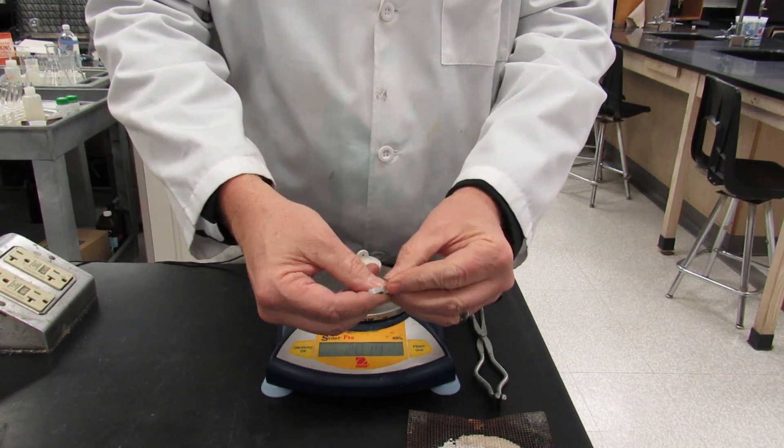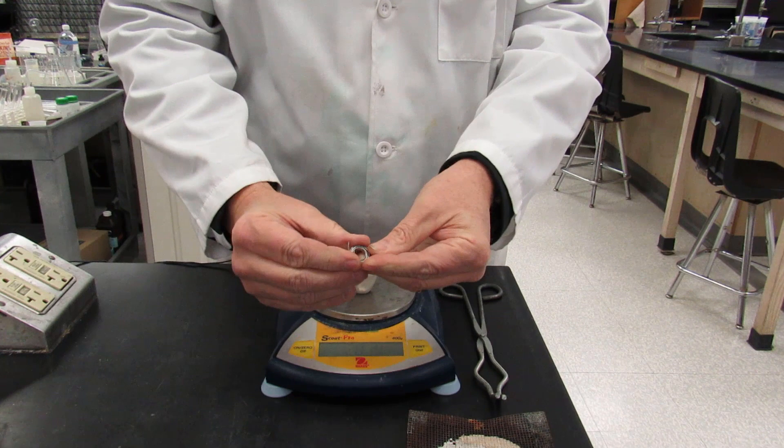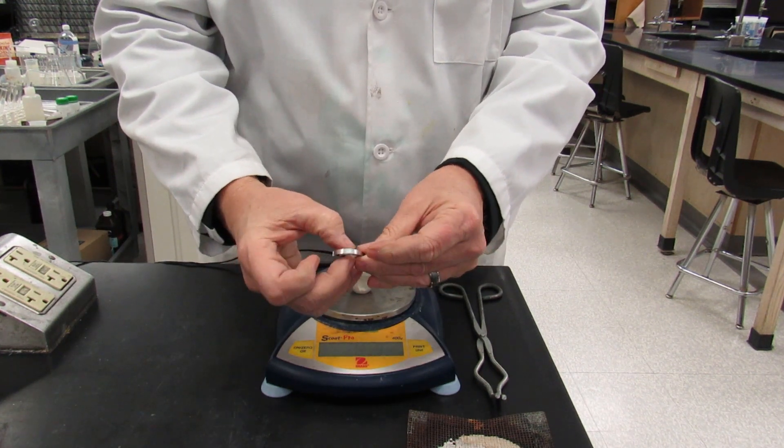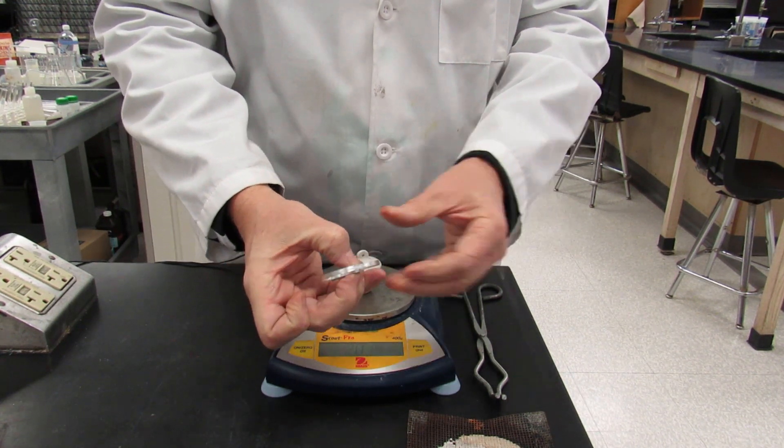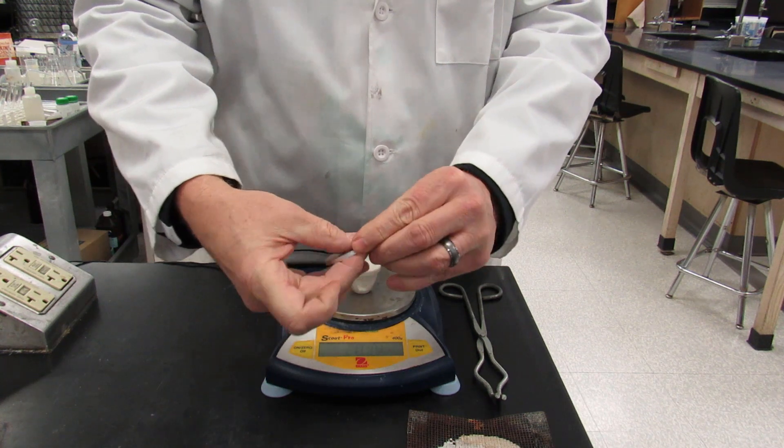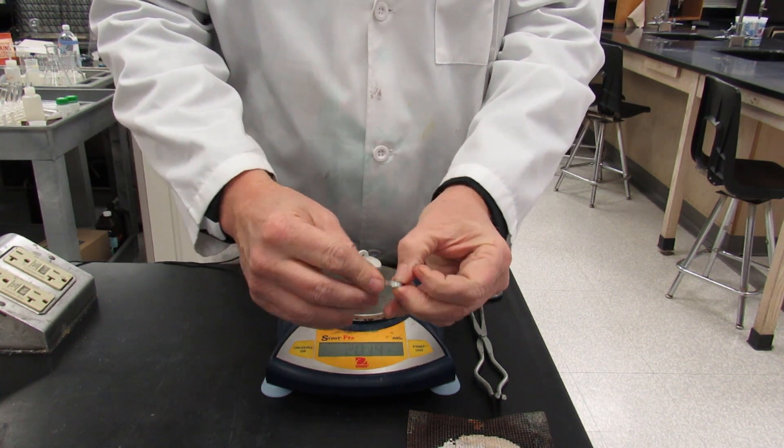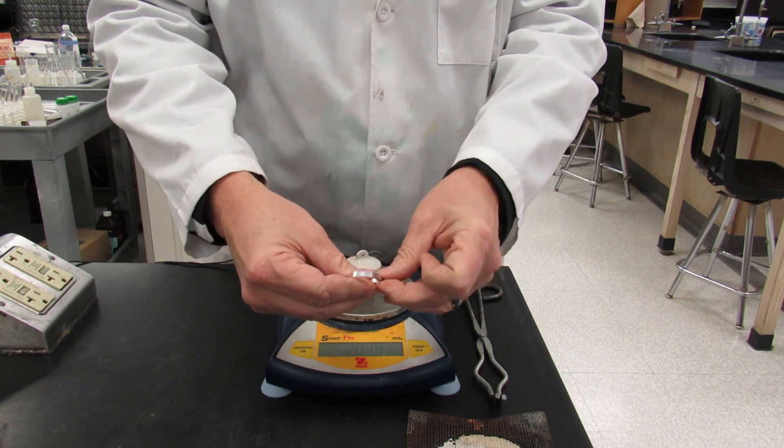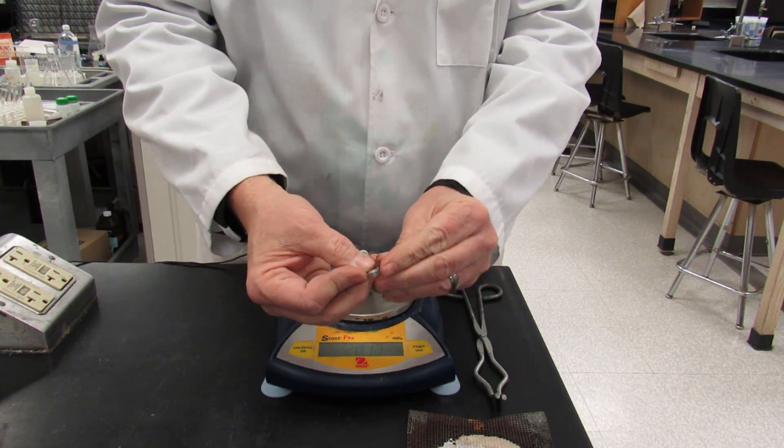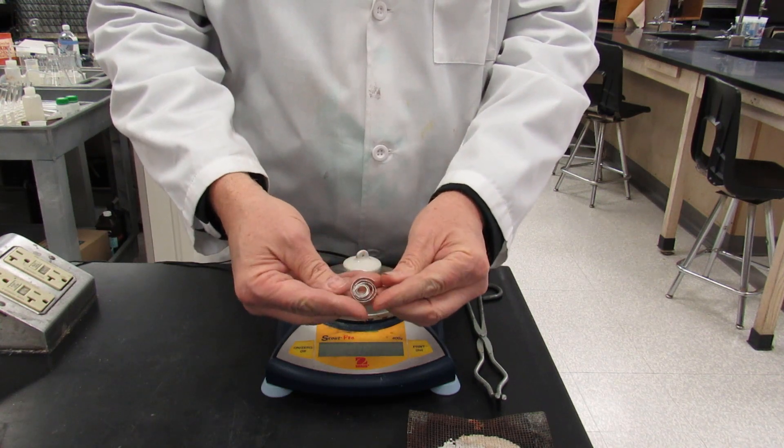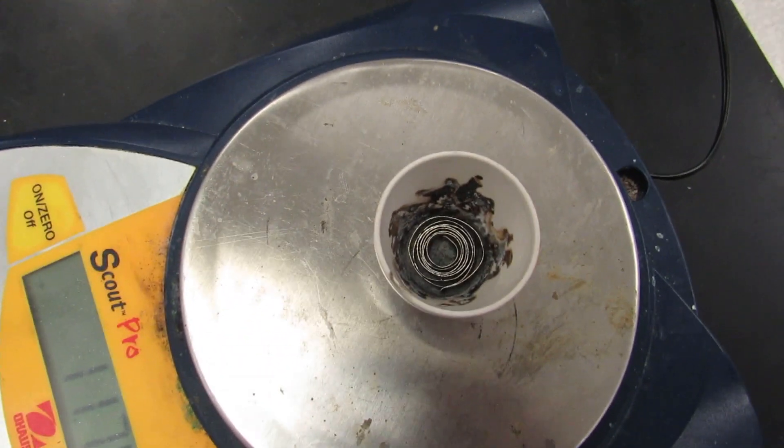That is really tight and completely placed in the bottom of the crucible. This is going to take a little bit of effort. The metal needs to be bent a little bit, but it will fit. Keep going tighter and tighter until it fits in the crucible. And this is what it will look like when it's done.